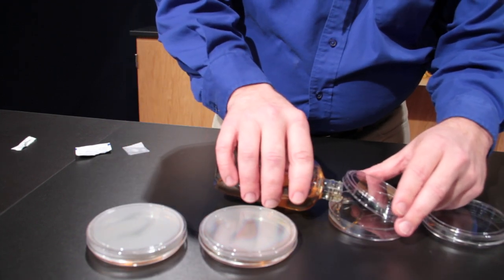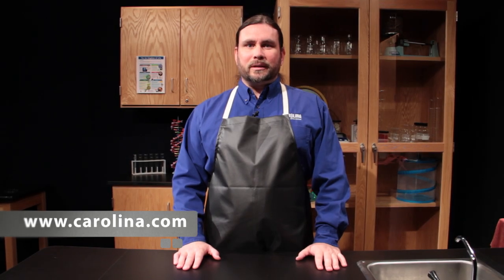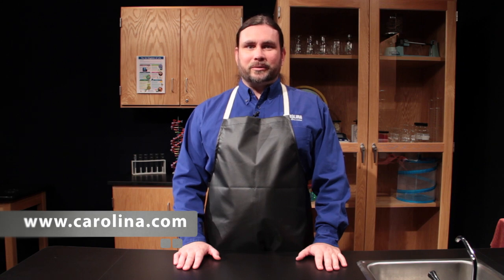Allow at least 30 minutes for the plates to gel before use. Go to www.Carolina.com for all your microbiological needs.